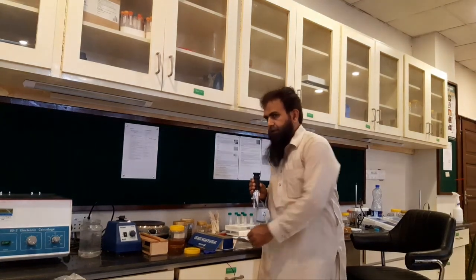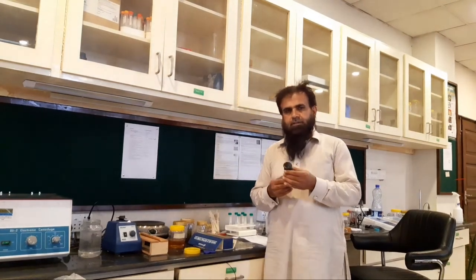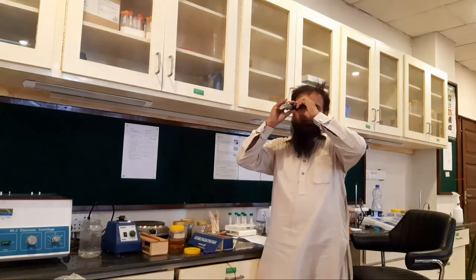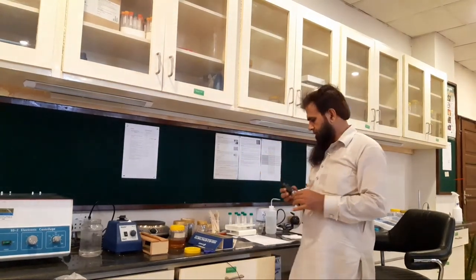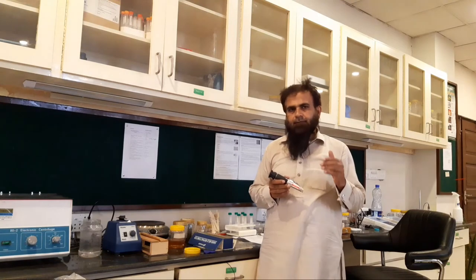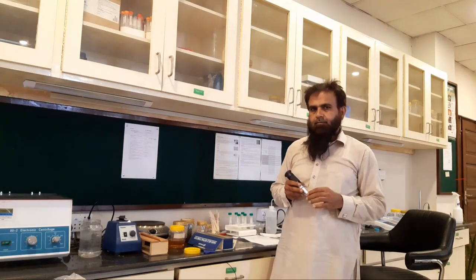Normally the value of moisture content in honey ranges from about 16 to 20, and occasionally it increases above 20. We hold the refractometer between our four fingers and thumb, and with our left hand we can adjust the visibility. We can see the intersection in blue color when we place a sample of honey on the prism. There is also a correction scale because this refractometer determines the moisture content at 20 degrees Celsius. If the temperature of the lab is more or less than that, this adjustment scale adds or subtracts a value from the observed value so we can accurately measure the moisture content in honey.